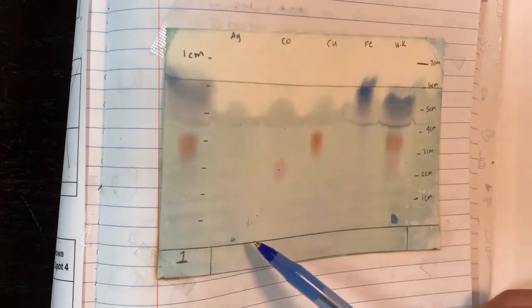I wanted to show you guys what a paper might look like once you did an experiment here. Kind of cool. You'll see every ion has its own spot here. If you notice, we marked the middle of the spot so we can measure with the ruler from the bottom to the middle of the spot for the dot for D, and then for the L is from this line to that top line right there.